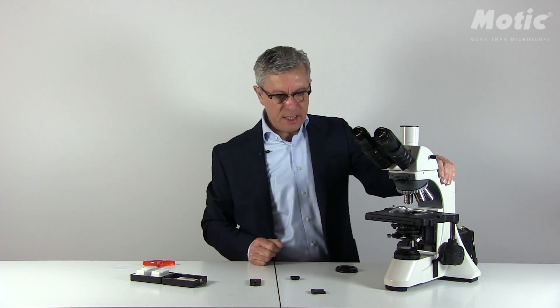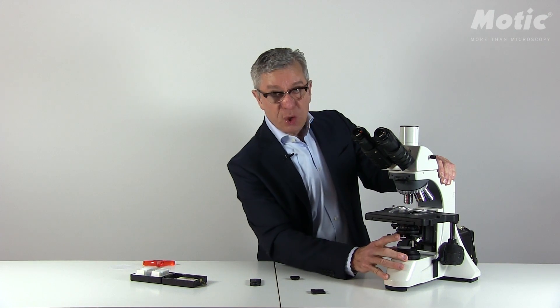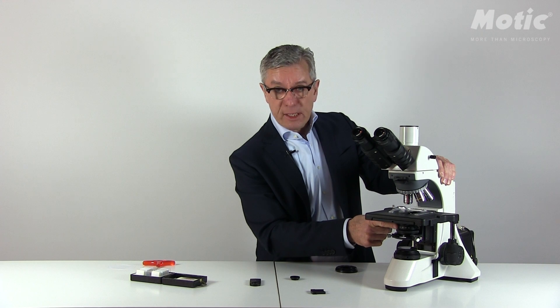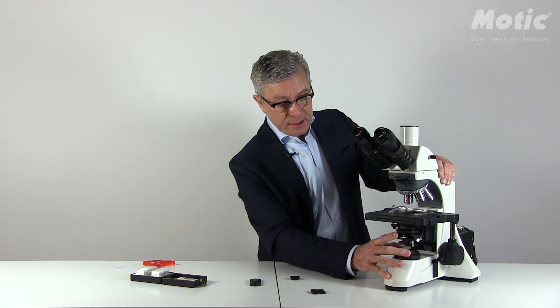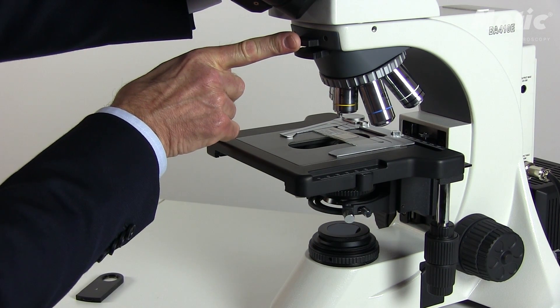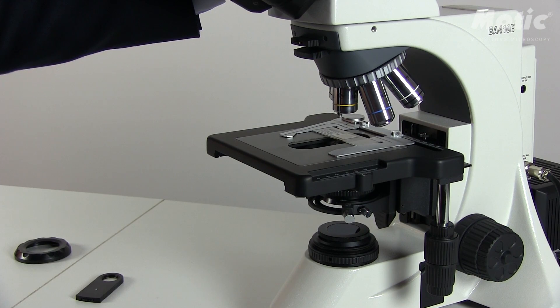Now the procedure is exactly the same. Do a proper Köhler setup — use the field diaphragm and use the aperture diaphragm for perfect bright field illumination. Then you may rotate the polarizer, or in this case the analyzer, until the background is as dark as possible.